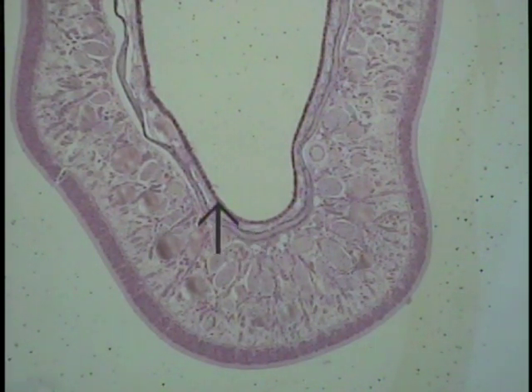A small bit of connective tissue forming a lamina propria anchors this particular mucosal surface to the bone, and so what you have really is a mucoperiosteum, where the mucous membrane is attached directly to bone, which is lying here. The covering surface is another very thick mucous membrane type of structure.